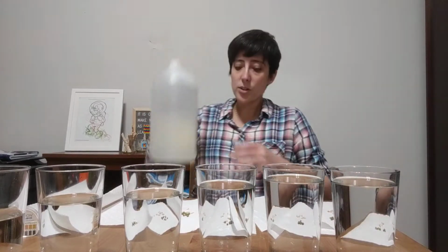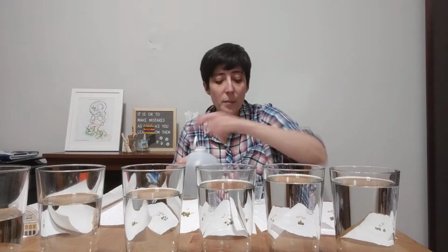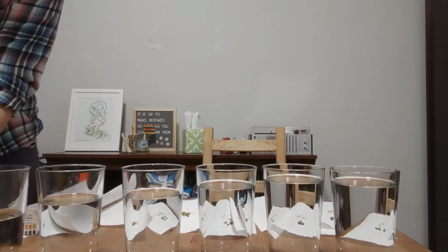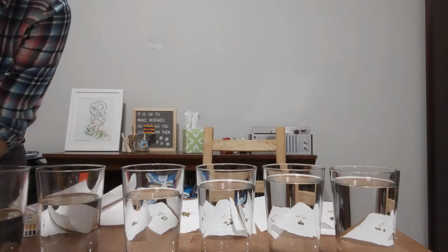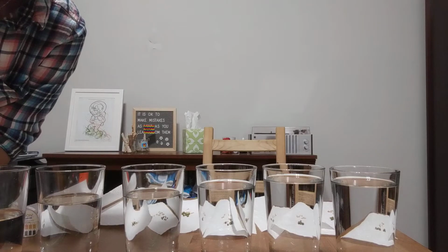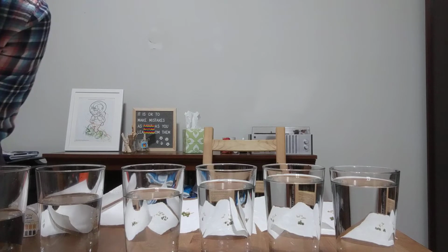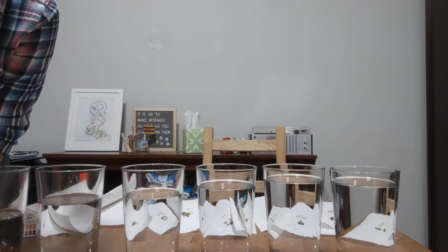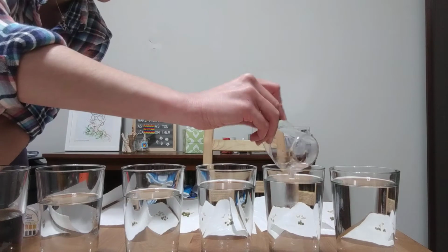All right, so first we're going to go ahead and start here, and I'm going to do 4 mils. Now I want to make sure I don't get any on these paper towels, so I'm actually going to move over to this side of the table to pour the vinegar, because if I get vinegar on those paper towels that are going to go in the Ziploc bags with the seeds, we won't get very good data. All right. Getting 4 mLs is going to be a little tricky. I have to pour a little out right now. All right, that looks good. So 4 milliliters.